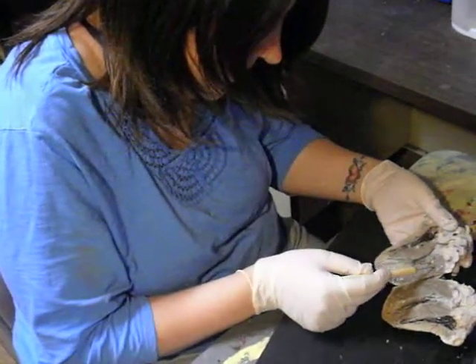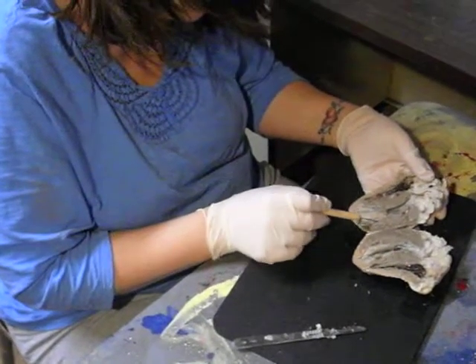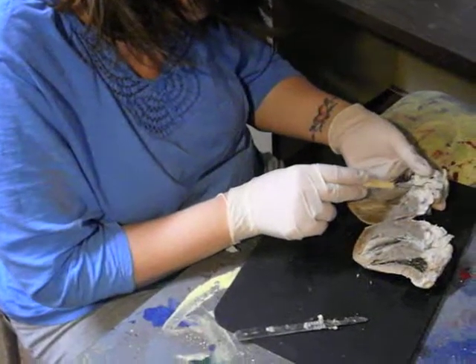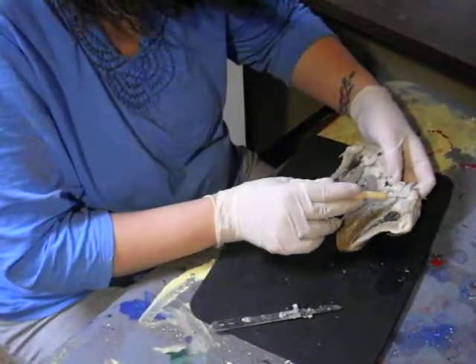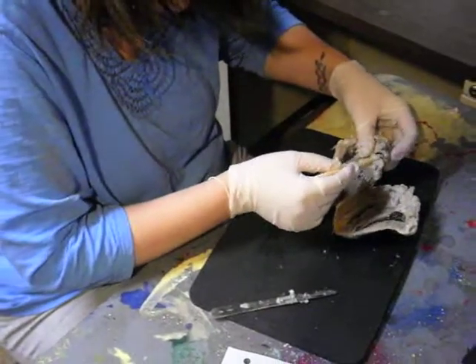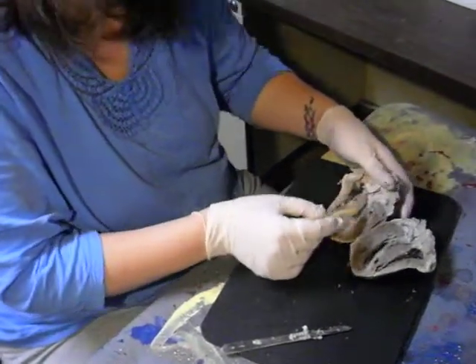This up here would be the left atrium, the bicuspid valve, and the left ventricle. And this is the pulmonary trunk in here. And this right here is the aortic arch. This is the left pulmonary vein.